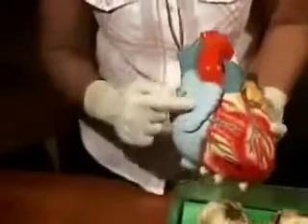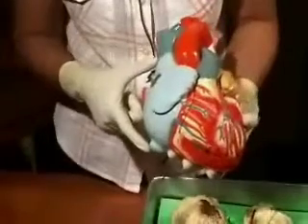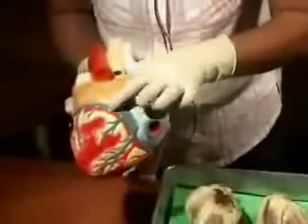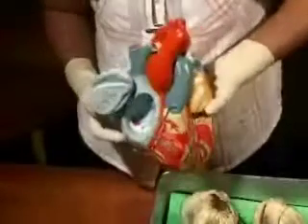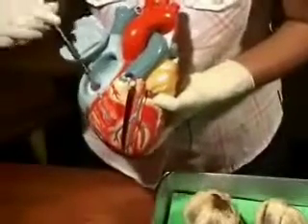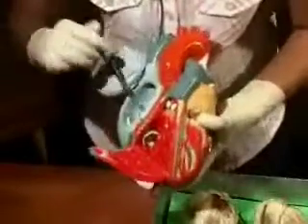Now, entering the right atrium are two major veins, the superior vena cava and the inferior vena cava. These are the two largest veins. And then we also have the entry of the coronary sinus, which is present here. So this enters going from left to right. Other openings which you see in the right atrium are the atrioventricular opening, which is this one. And this is where the atrium communicates with the right ventricle. So the right atrial blood enters the right ventricle. And these are the caval openings up here.